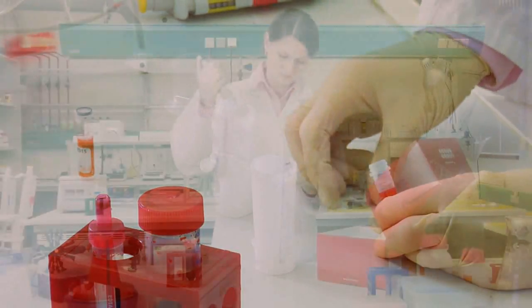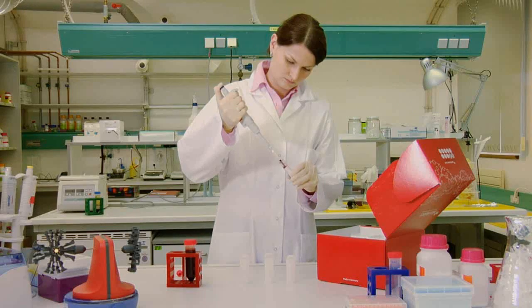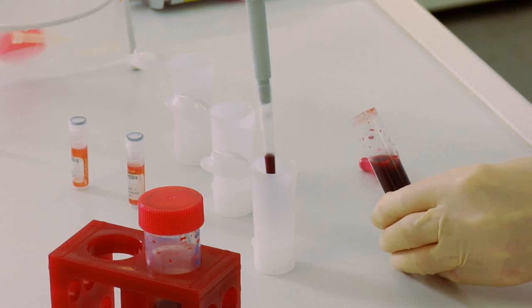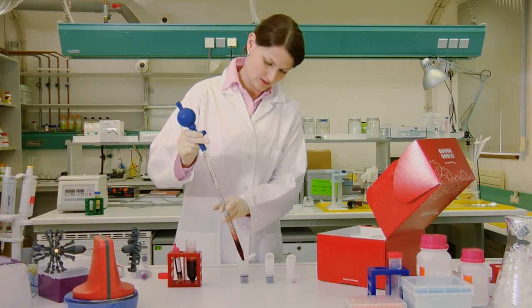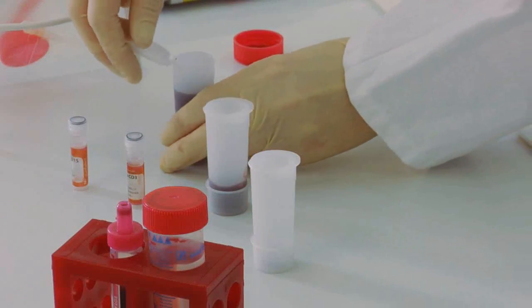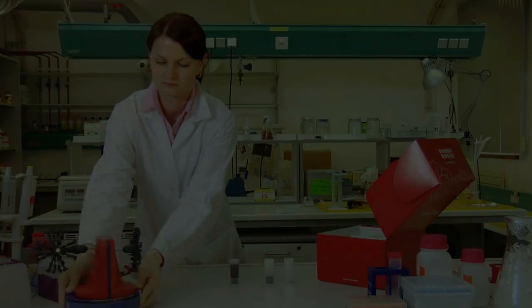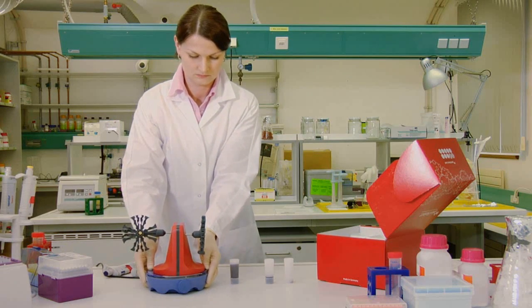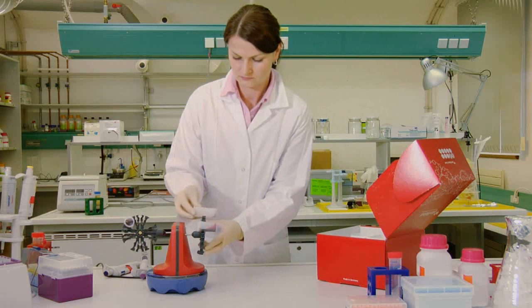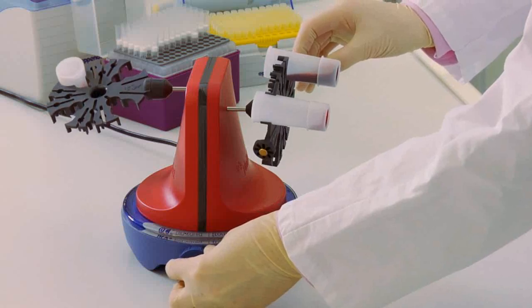Then use a pipette to add sufficient particles for the current sample to the mixing container. The sample material is then added. Now mix the container using your mixing system or using the Pluriplex Universal Mixer from Pluriselect.